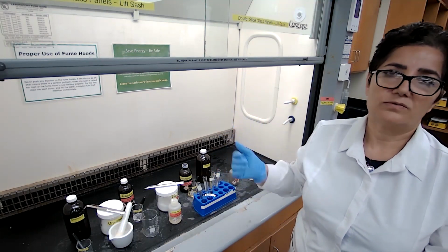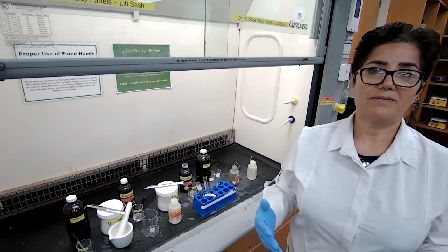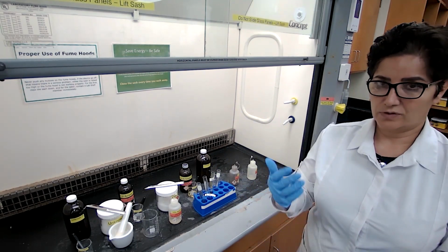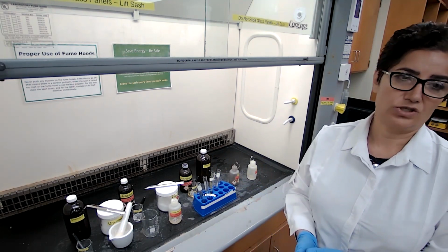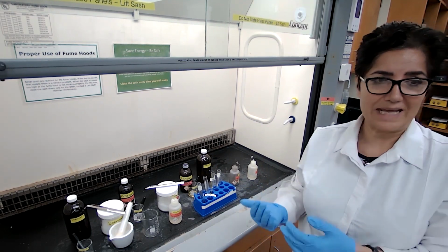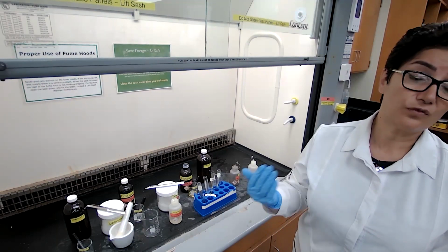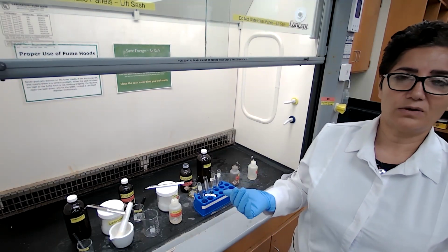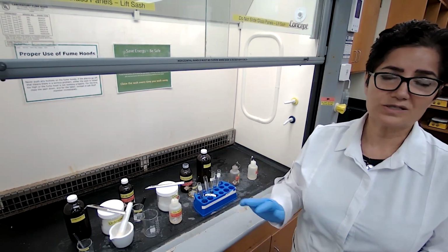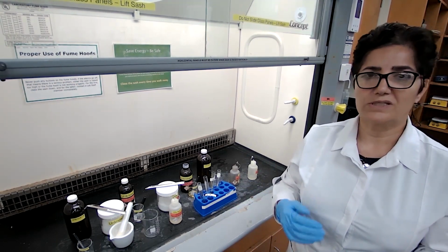That is the end of this experiment. Please record your observations carefully and make a table. Organize it so you can identify each unknown and the functional group for each unknown. We cannot determine the name of any of these unknowns, because determining the name requires more physical properties of the unknown, which we are going to do in the next 2 experiments. This is just qualitative analysis to determine the functional group for this experiment.